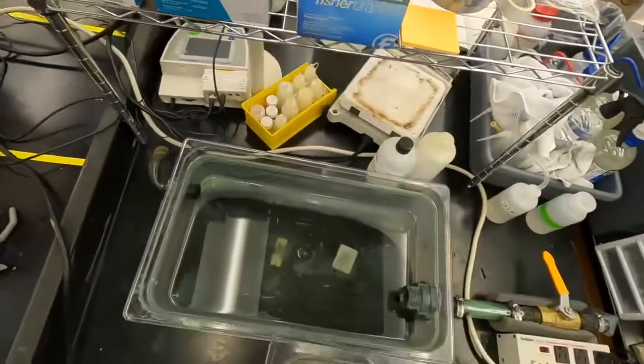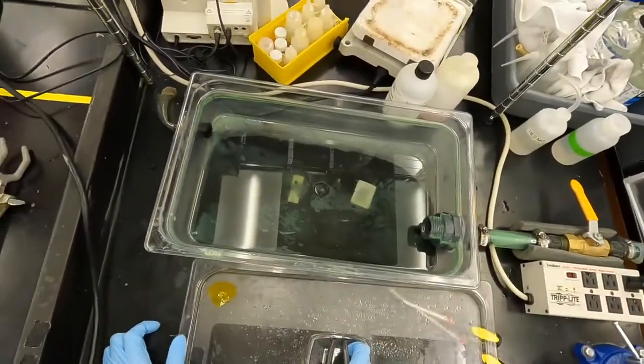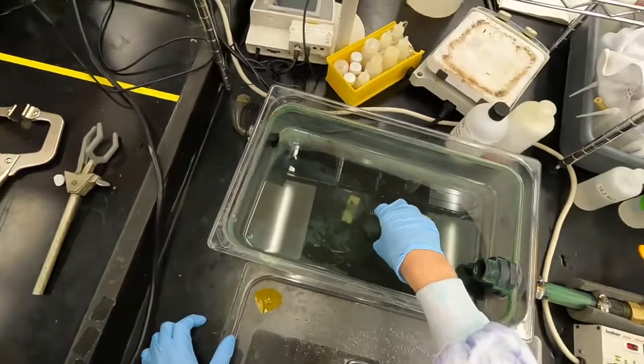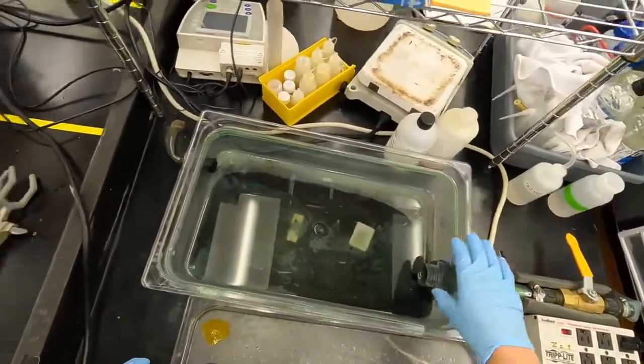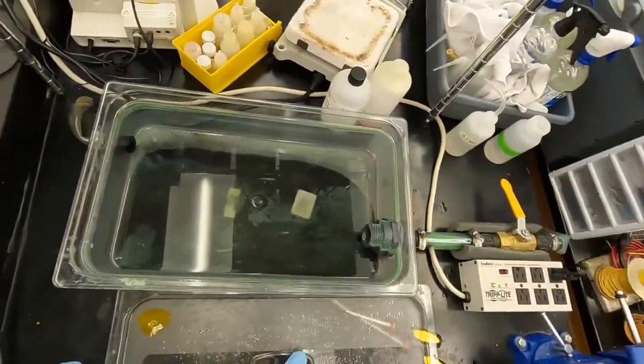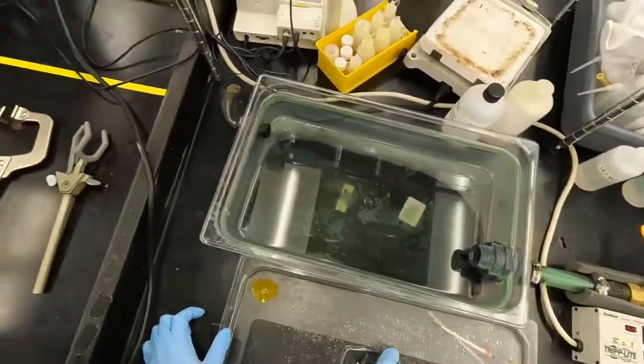This is the water bath that you'll run the experiment into. Basically you take the cell and submerge it in here, either directly in antifreeze or in a plastic bag, and this cools down the reaction cell to cause the crystals to start forming.